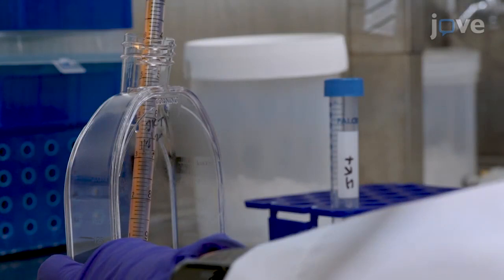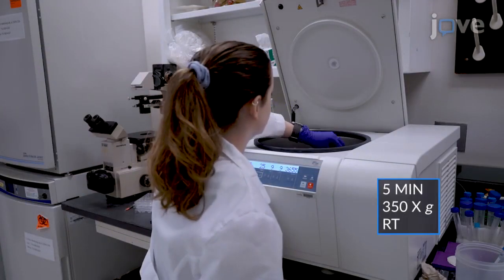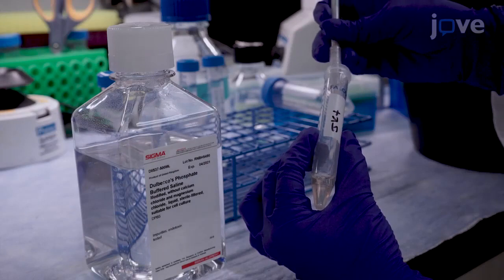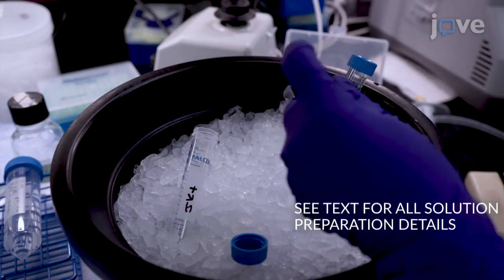To obtain cell lysates, collect the cells of interest into a conical centrifuge tube and remove any cell debris by centrifugation. Wash the pellet in 5 milliliters of PBS and immediately resuspend the cells in 600 microliters of freshly prepared lysis buffer.